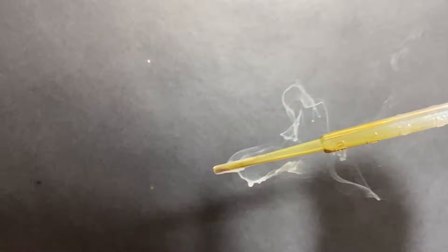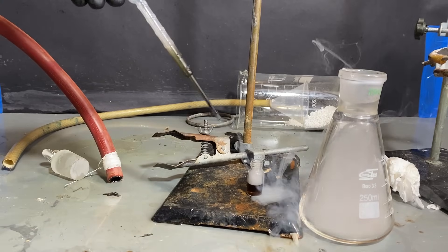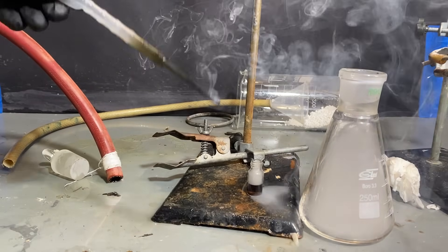Anyway, the cool part about chlorosulfonic acid is how much it fumes, and how dense the white fumes are. Here you can see me shooting some fumes from a pipette, and I must tell you it's really cool to play around with.